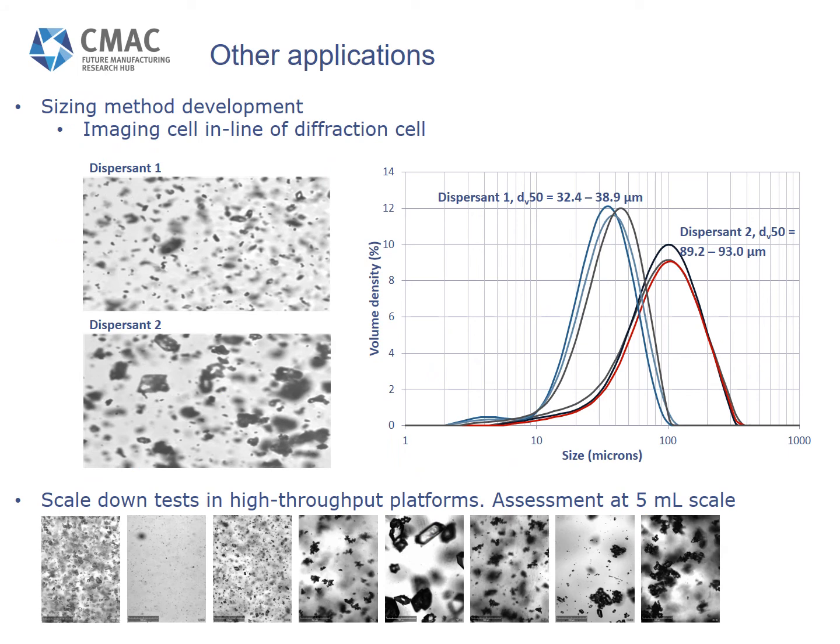So finally, I'd just like to highlight some other areas where we're using particle vision tools as part of crystallization process development. Now, laser diffraction is a fairly commonly used technique for particle sizing, and if we're doing a wet dispersion, we need to have careful selection of that dispersant to ensure that the particles that we're measuring are representative of them in the process. Here we can see particles from the same batch which have been suspended in 2 different dispersants, and you can see quite distinctly here that dispersant 2 is producing a much larger PSD compared to dispersant 1.